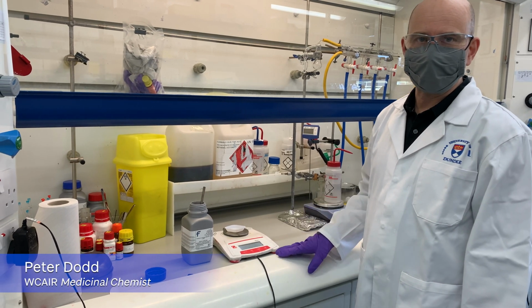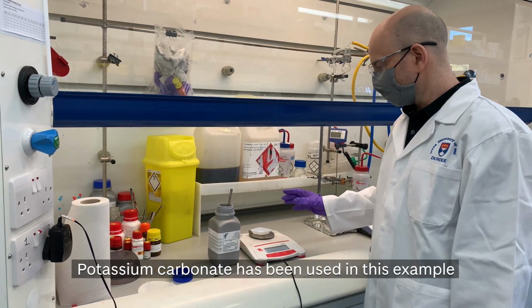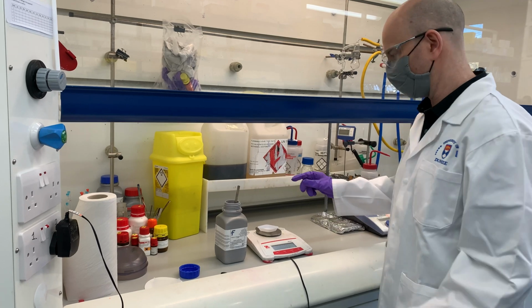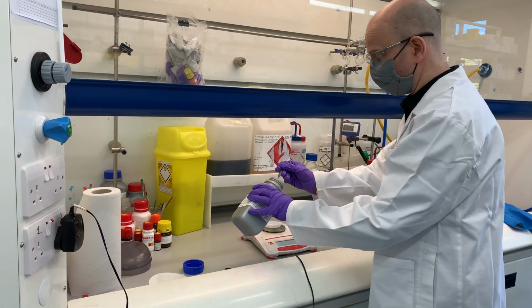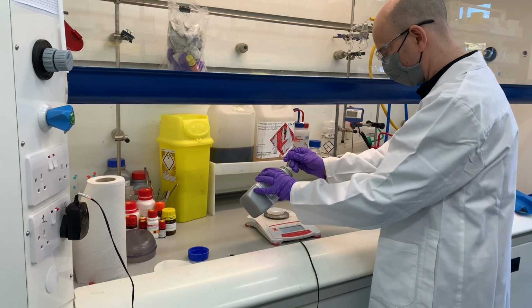So I'm going to show you how to manage a small powder spill inside of a fume hood. So I'm going to weigh out some potassium carbonate. I just have the balance inside of the hood. You would normally have these in different cabinets, but we're just going to do this over here for convenience. Potassium carbonate is pretty prone to static, so it's quite common for it to spill from the spatula when you're trying to put it onto your weighing boat.